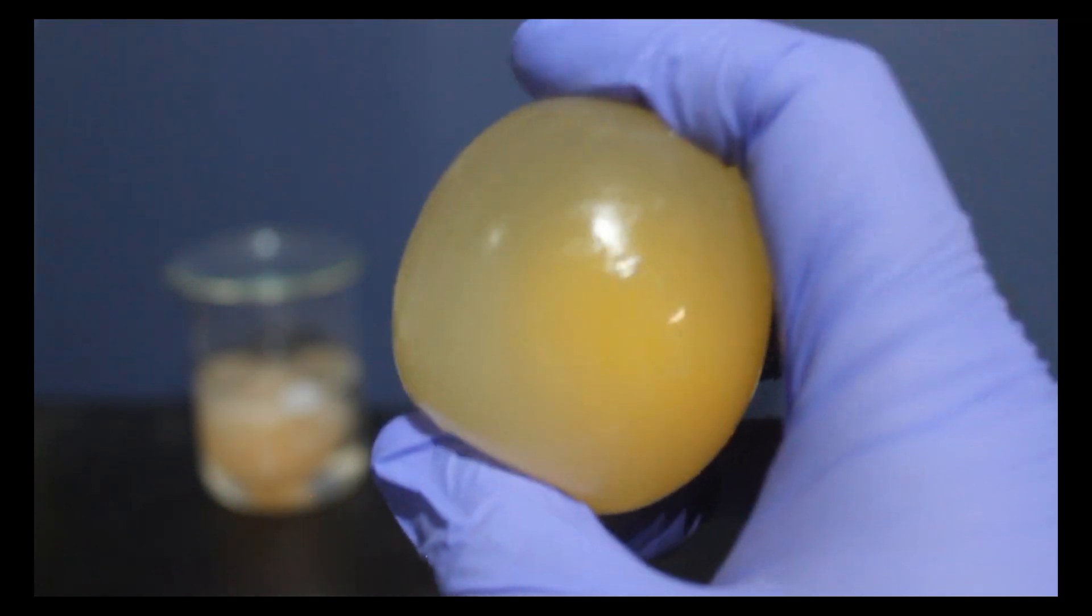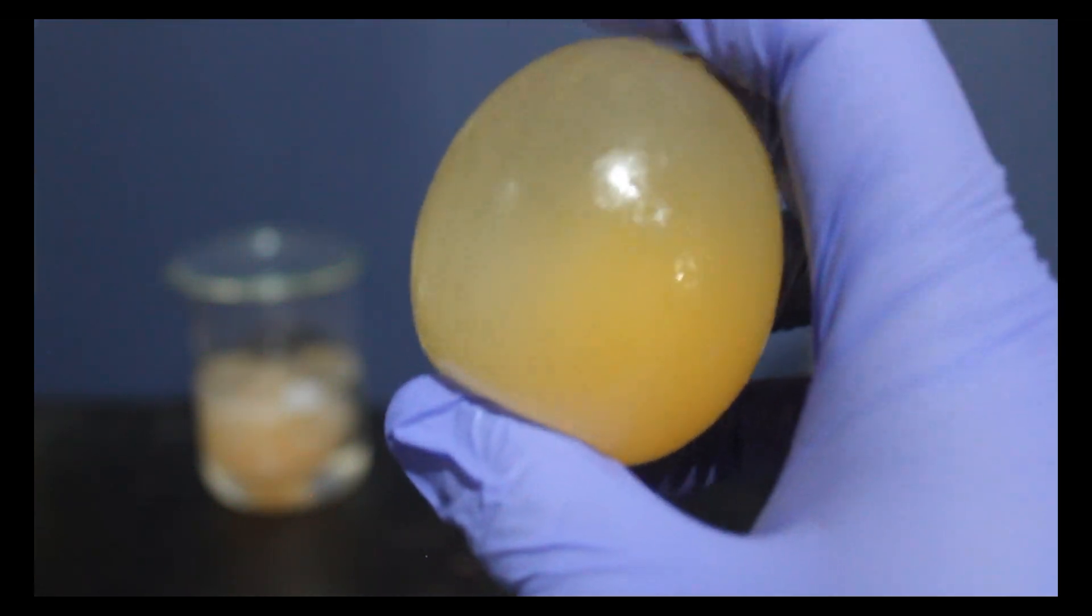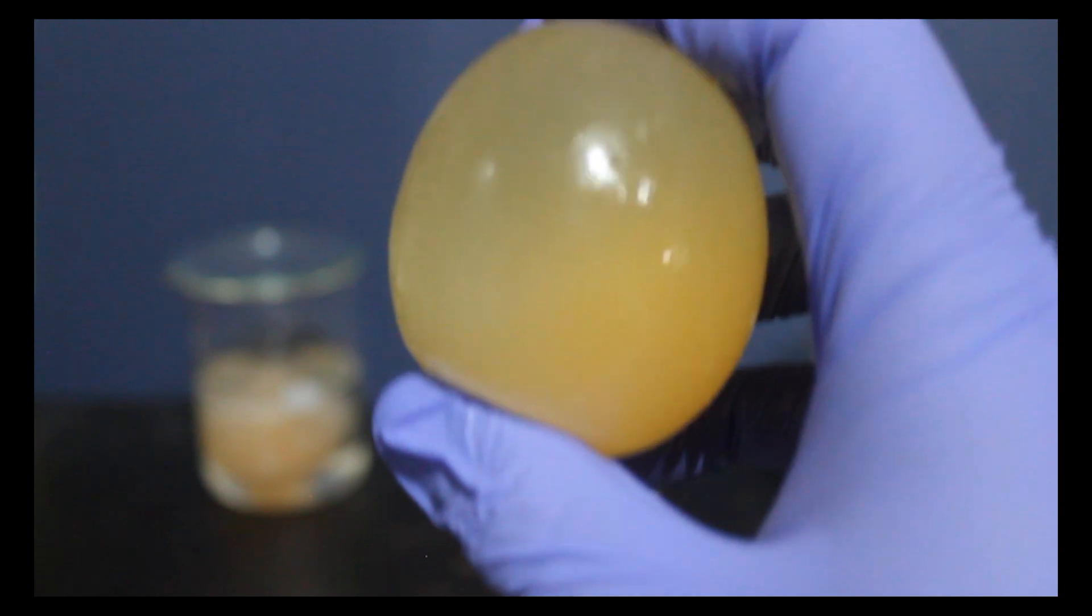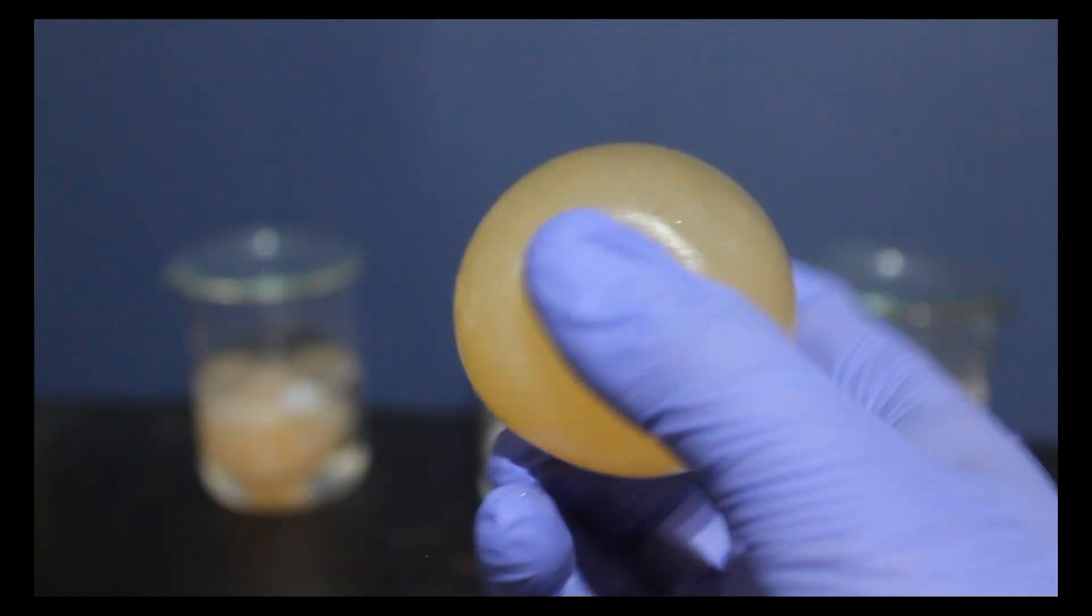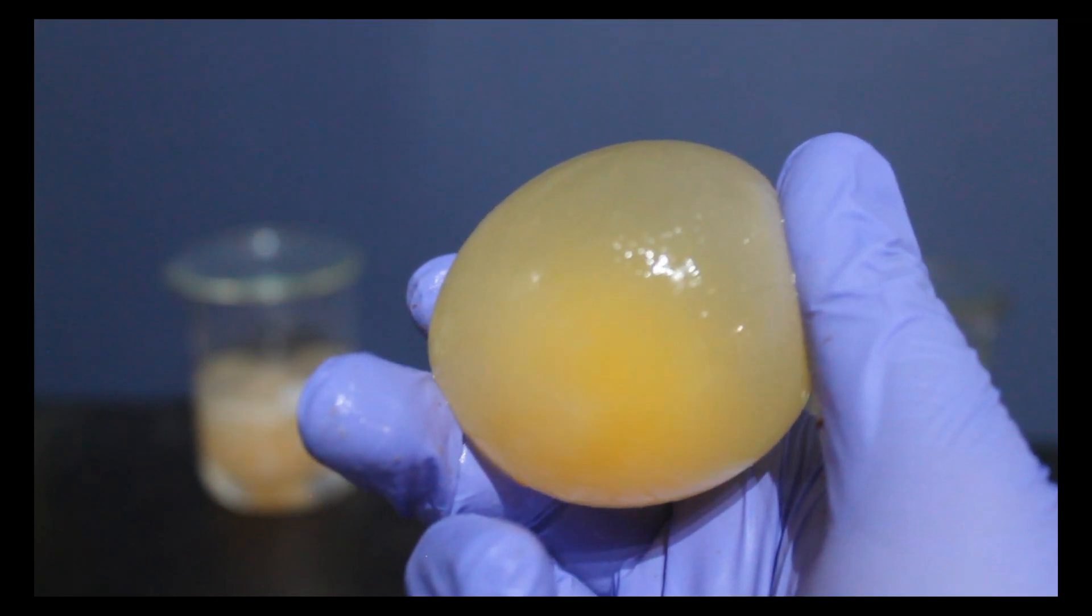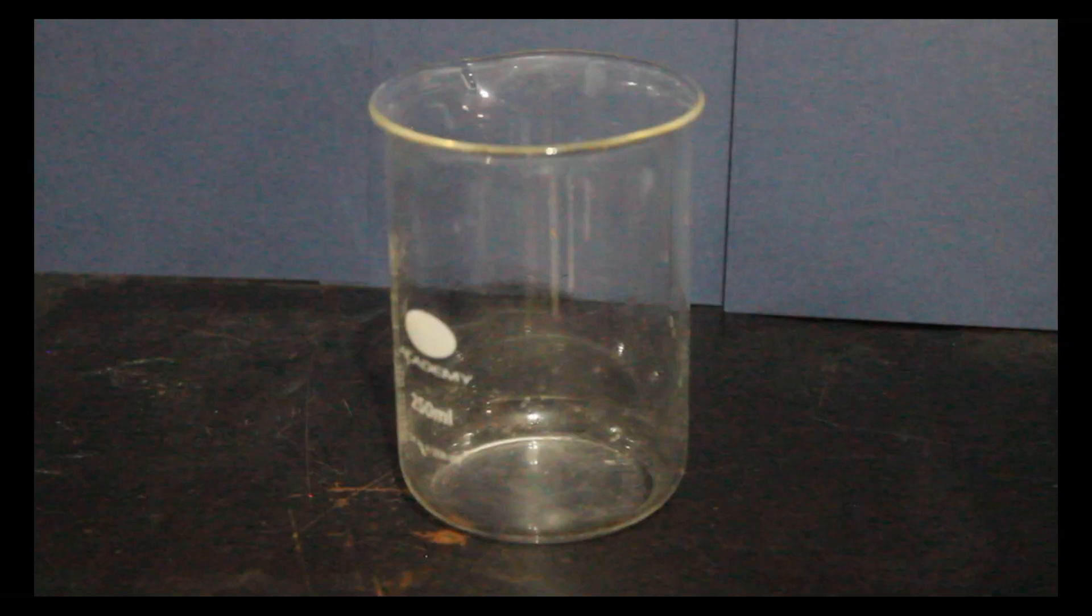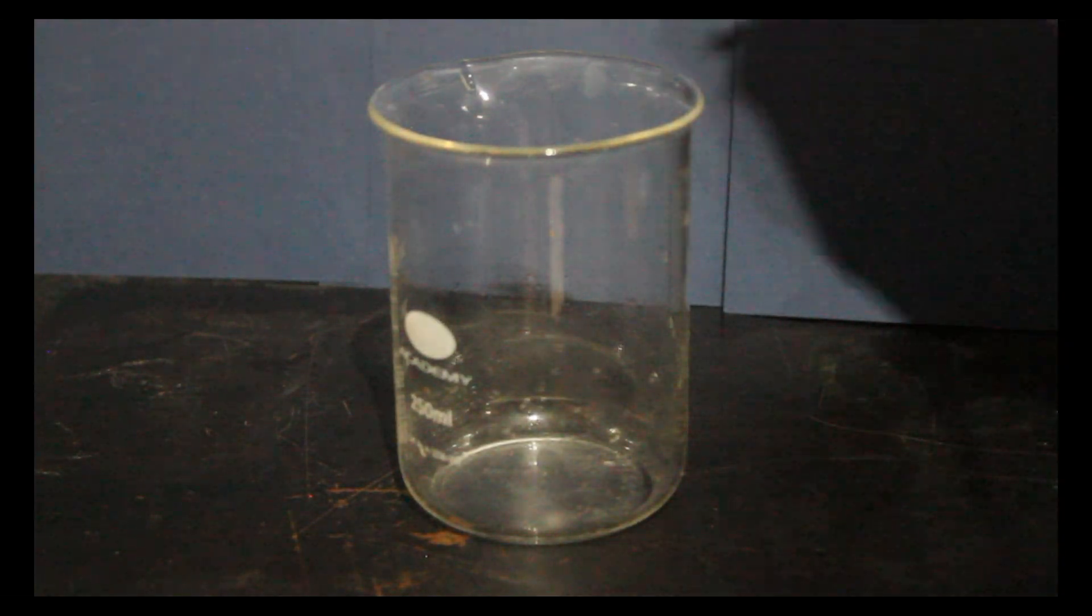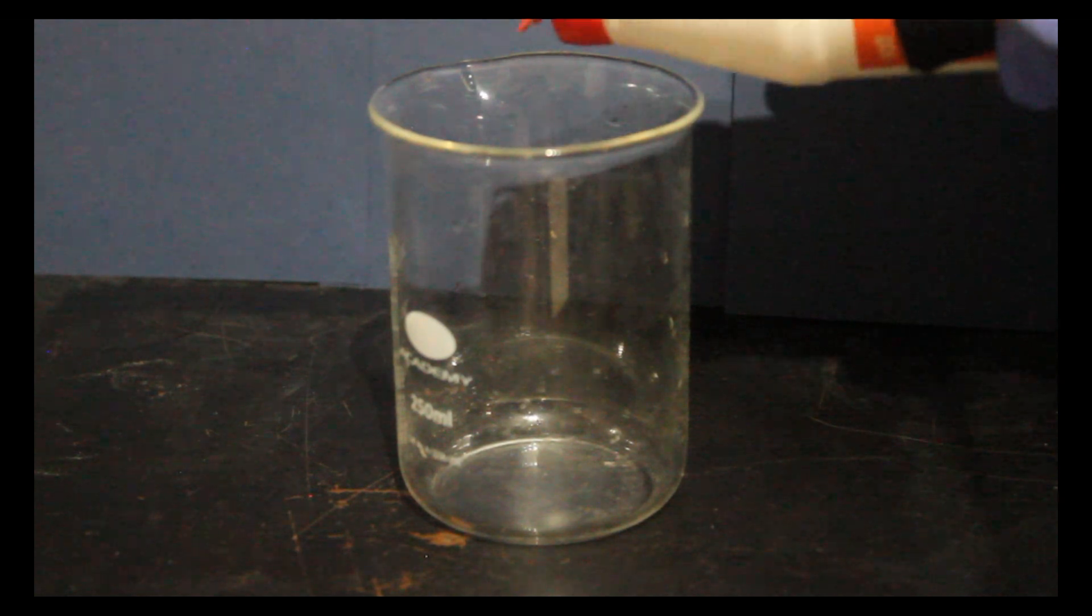We will be putting these eggs under three different stresses which certain microorganisms have evolved to resist. The first stress that we'll be putting an egg under is high salinity or a high concentration of salt.